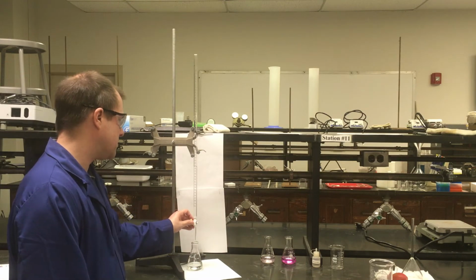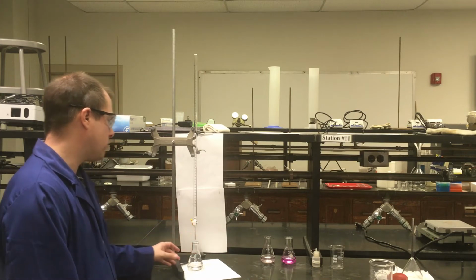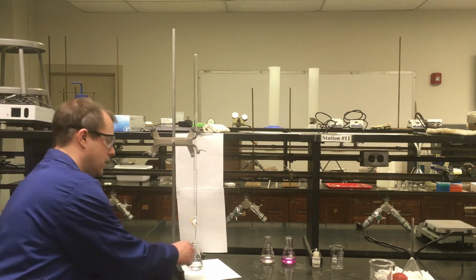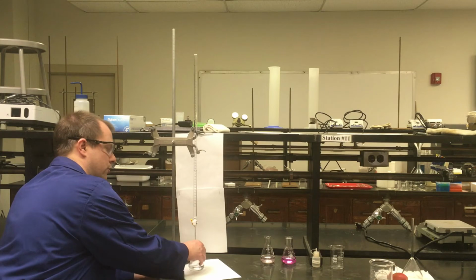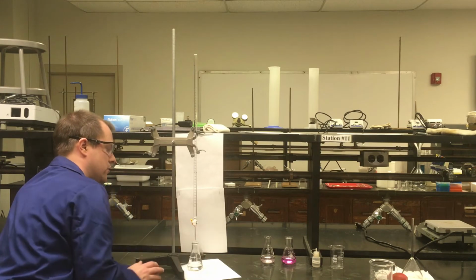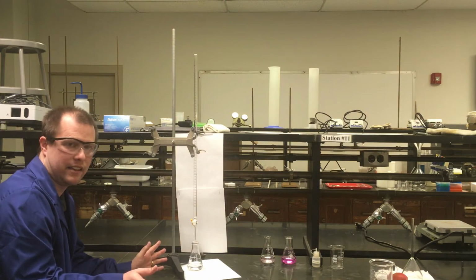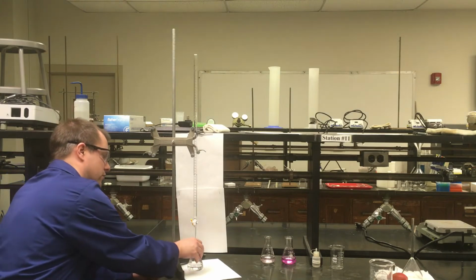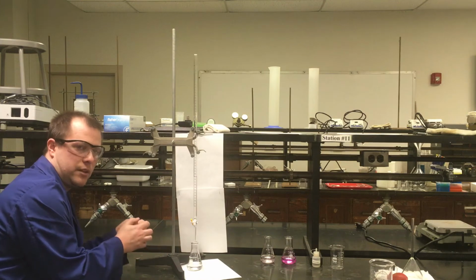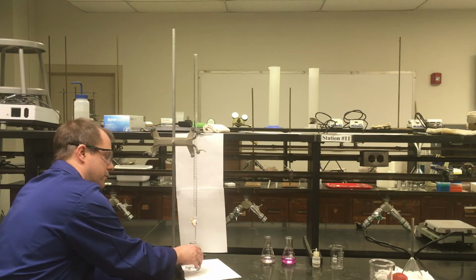So right now I've added a little less than 20 milliliters. I'm going to start adding again, but at a much slower rate, now kind of drop-wise. And you'll notice here, again, the pink color is forming, so now I can basically just constantly swirl this solution as I'm going drop-wise. I'm just going to wait for, as I get closer to what should be the end point of my experiment, the color not to go away when I swirl and stir the solution. Eventually one of these drops is going to hit, you're going to swirl it, and the pink is going to go everywhere and stay there. That's what we're really trying to get to. That'll be our end point for this reaction.